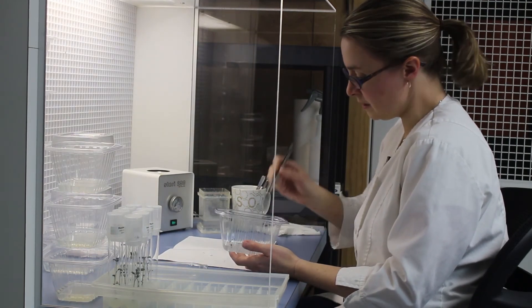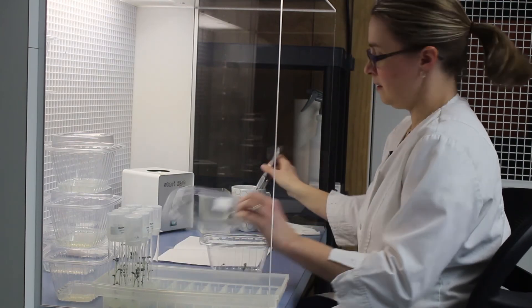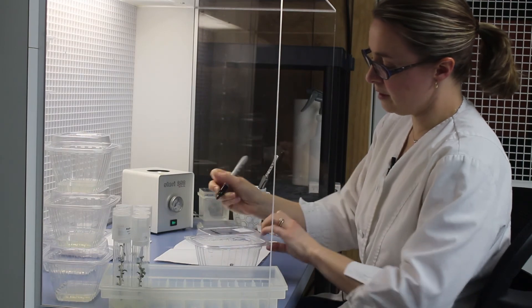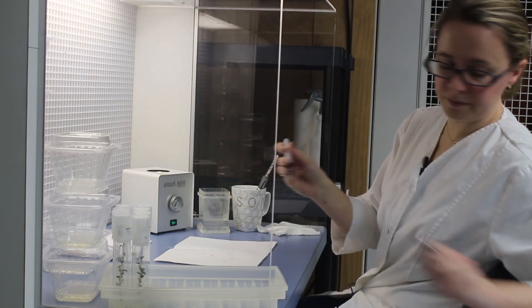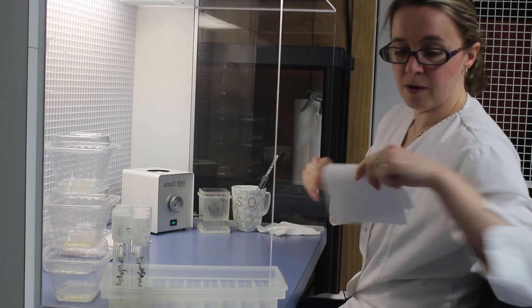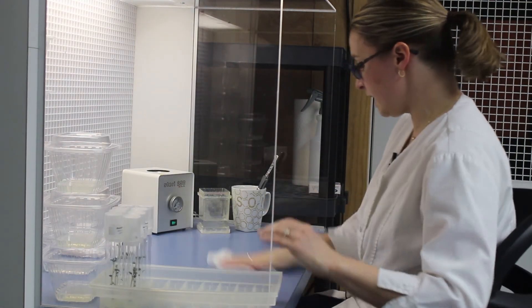Got four cuttings off of that plant. Close that up and I'll write how many plants are on here. We label all of our containers. So there's no question what it is. I'll throw away the paper and start over with the next one.